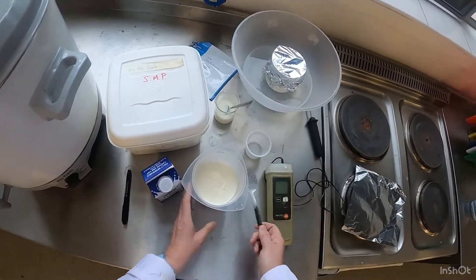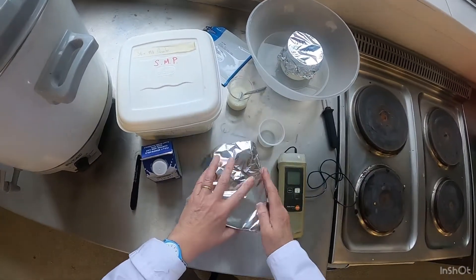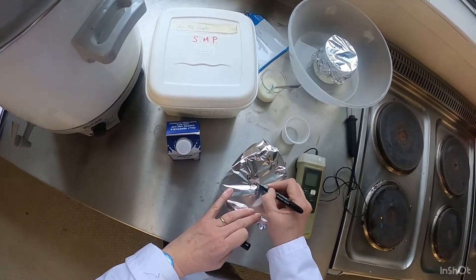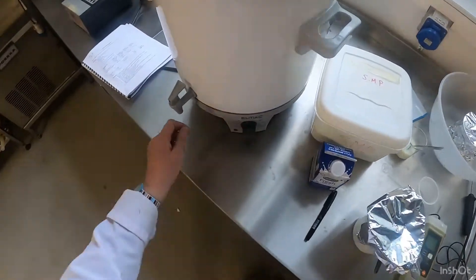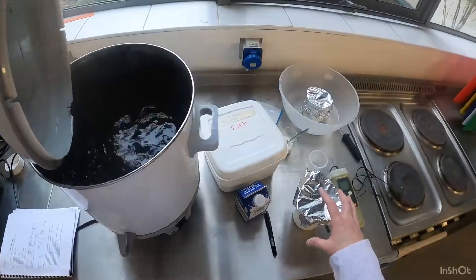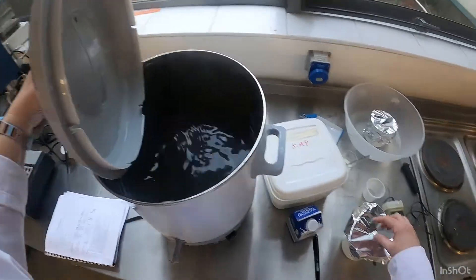That's much better now. We're going to cover it over with some tinfoil — I'm going to write that this is whole milk, so it's going to be whole milk yogurt. In here you can see we have a water bath and I have it sitting at 85 degrees. Our first step was to add the skim milk powder to preheated milk at about 50 degrees.